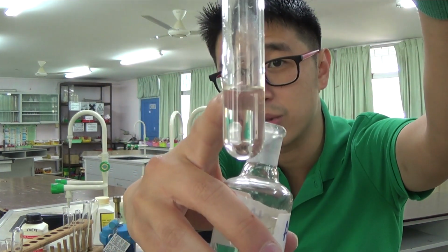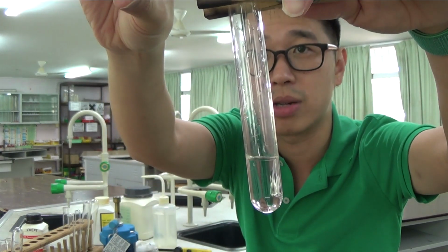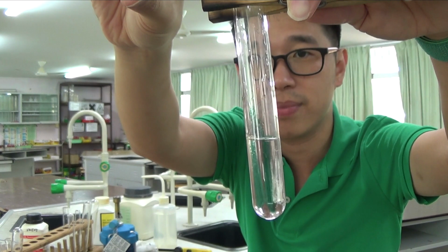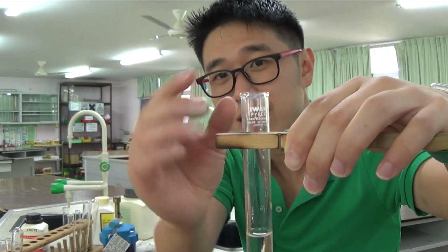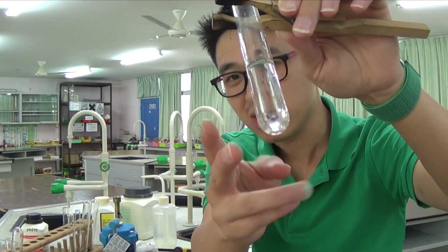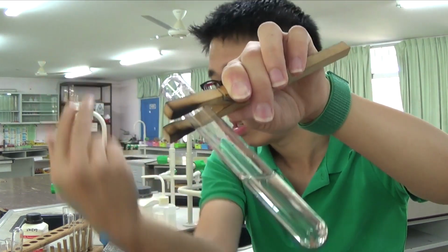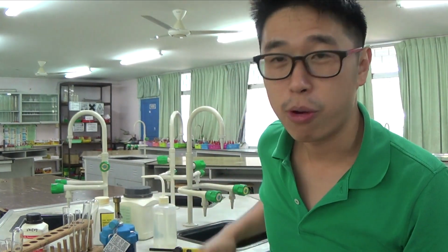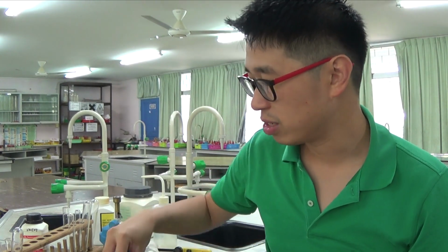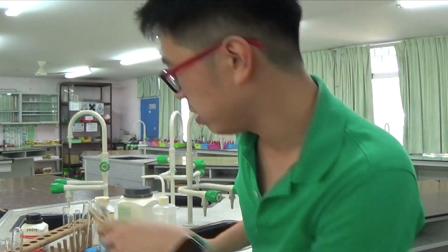Because I've got this much solution, ideally I should be using half of it. Then I don't need that much sodium hydroxide, because you do not want your solution to be too full. When the solution is too full and you heat it, you run the risk of bumping. Bumping means the liquid jumps sideways, you see how the volume has gone higher on the side. When it bumps, it's very dangerous to the people next to you as well as yourself. You should know that you never ever point a test tube that you are heating at yourself or at other people, right? So I'll close my Bunsen burner air hole.